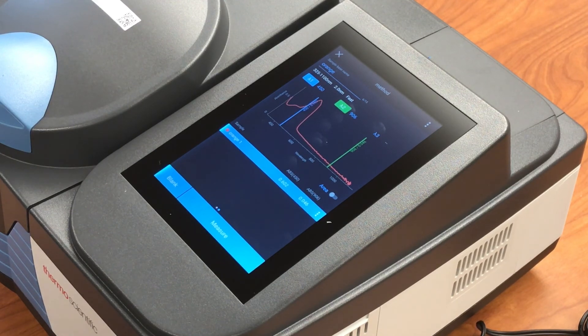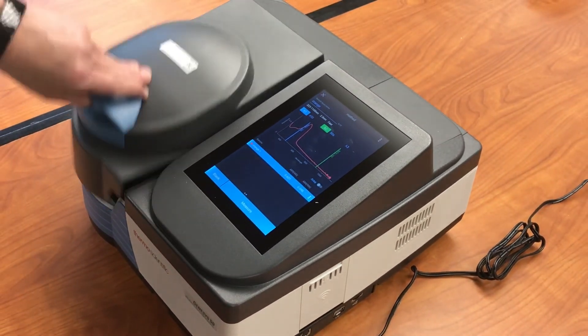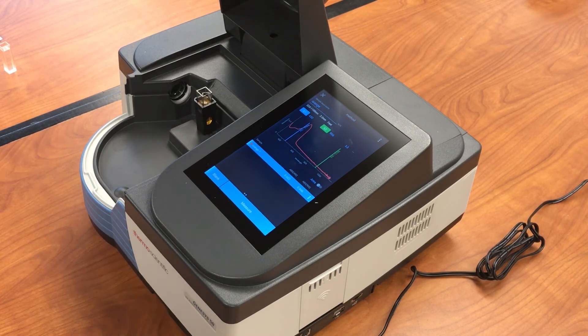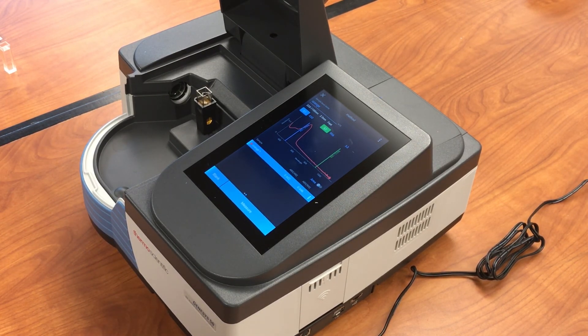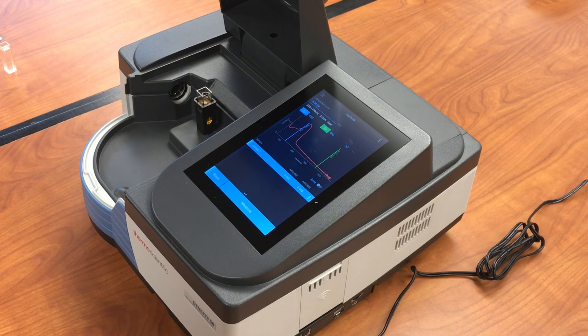When you're done with this sample, you simply remove the sample from the cuvette. Clean out your cuvettes when you're done. And that is how to obtain the spectrum of a sample.